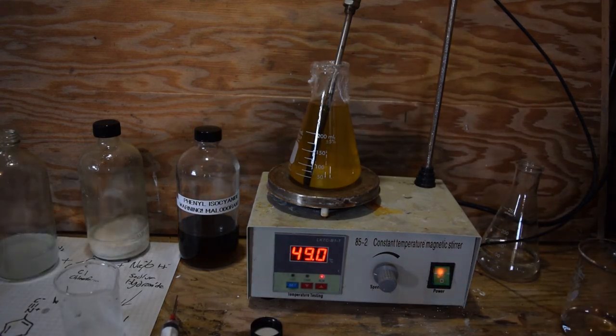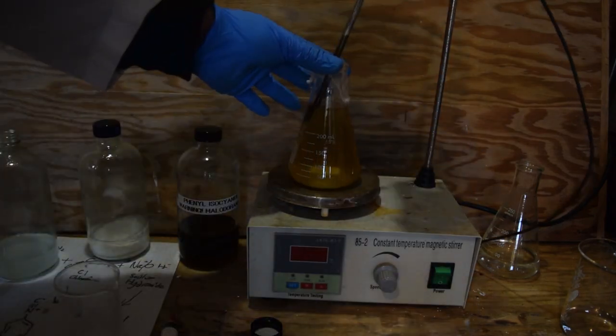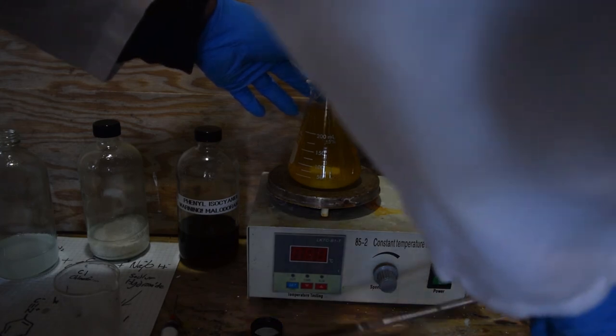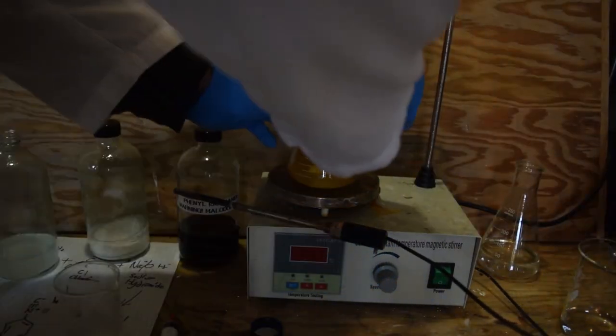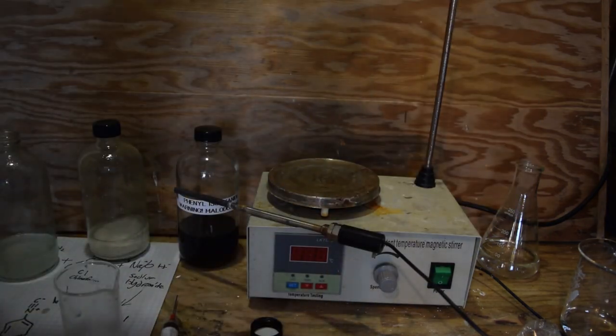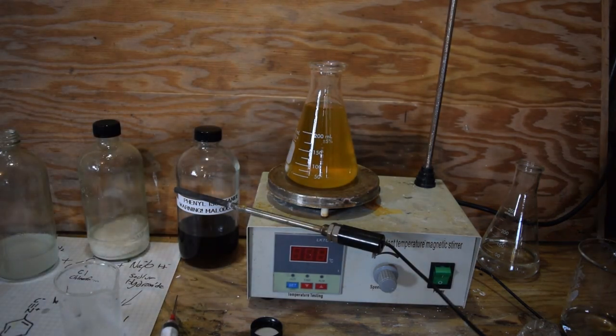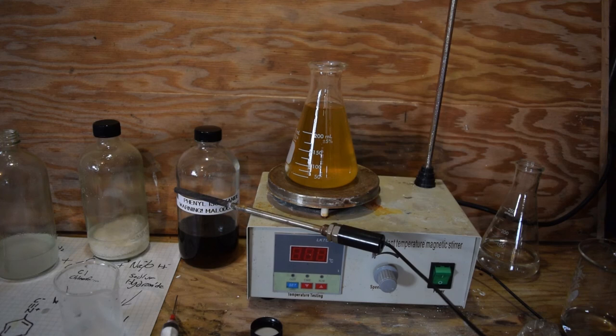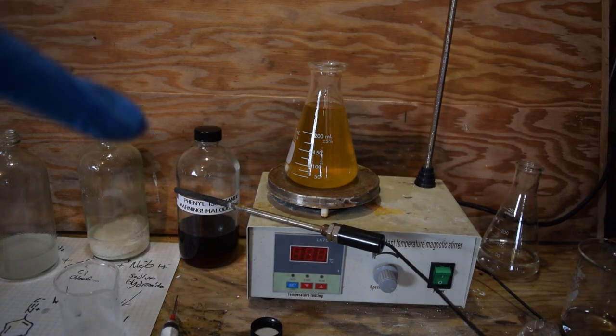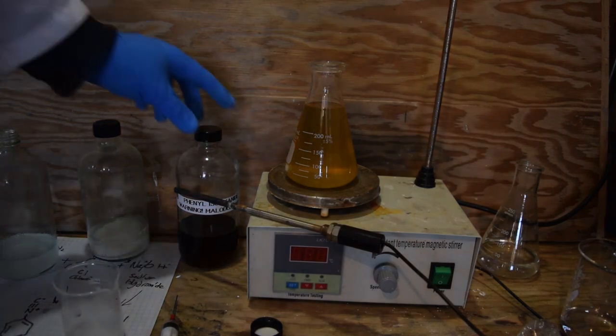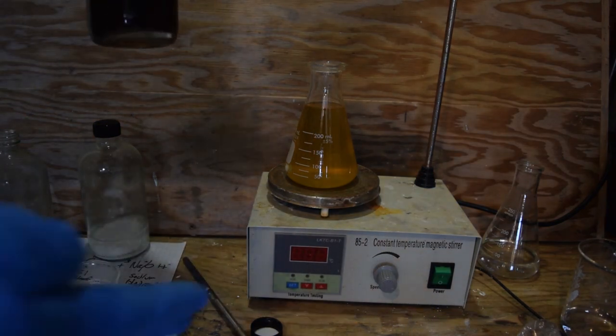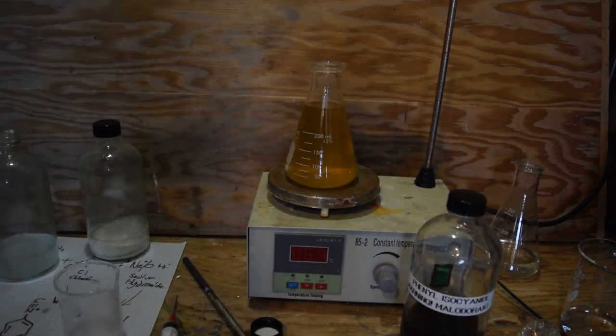All right, now the moment of truth, let's see how stinky it is. It's not going to be super powerful at first because that ethanol is very hot and it's really going to overpower anything else that's in there. But that's some pretty good stuff. So what I'm going to do now is I'm going to let this cool for a few hours, and I'm going to add it to my other stock solution.